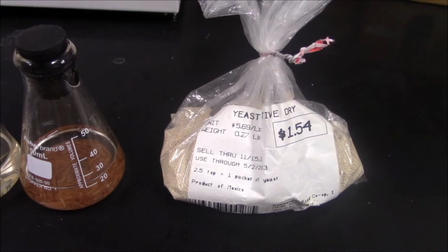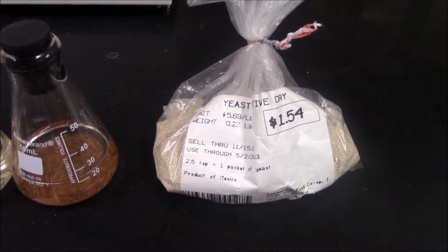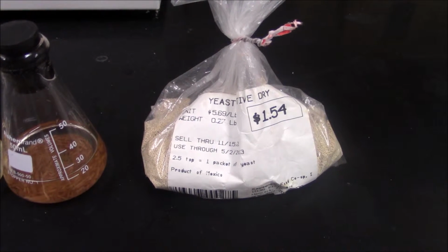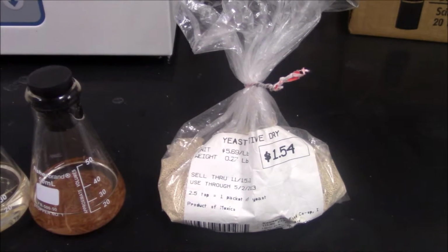During fermentation, yeast will consume the glucose in the solution in the absence of air and produce ethanol, water, and carbon dioxide. The product we are interested in is the ethanol, since it is to be used as a renewable advanced biofuel.